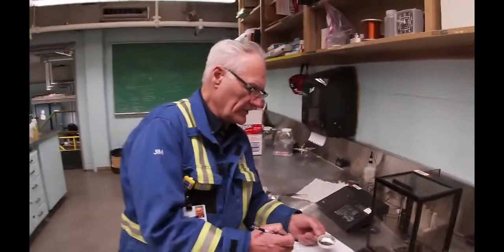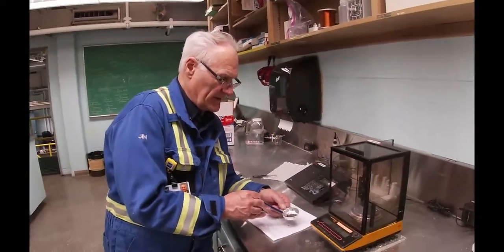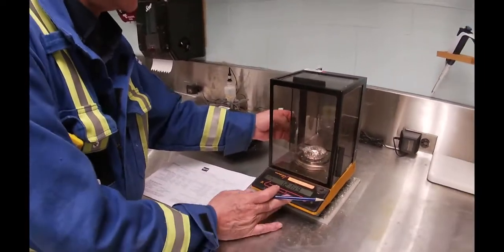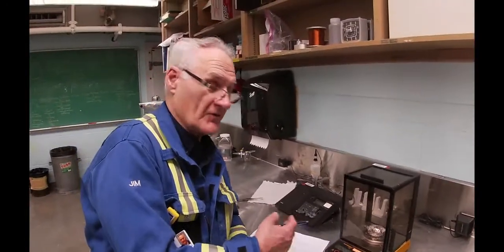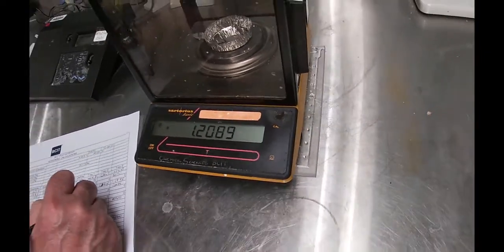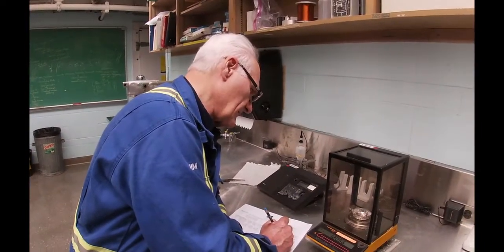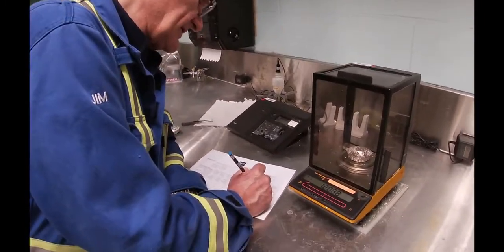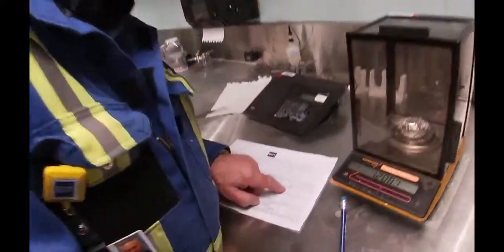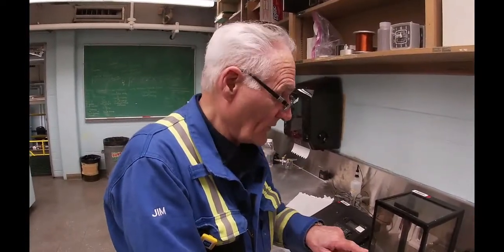So we've got these little trays and we've collected the debris that came off the number 10 flat screen from a given sample. Now we're going to measure it wet. I'm going to put it on this scale — it's fairly sensitive. It's so sensitive that you really need to close that door so there's no air drafts. It's now showing 1.0295. The tray itself weighed 1.0233, so we're only looking at 0.006 grams for the weight of that fiber that's on there.